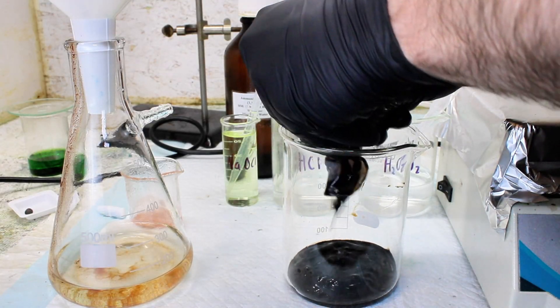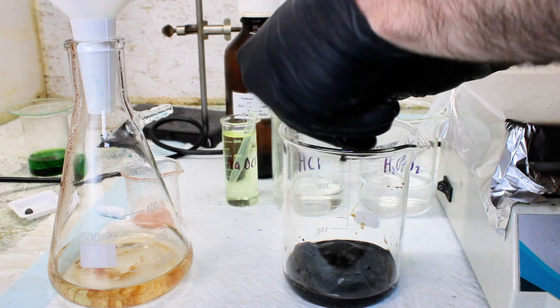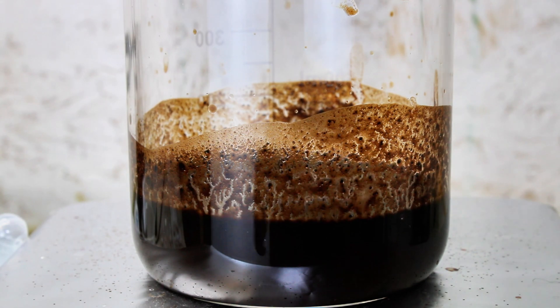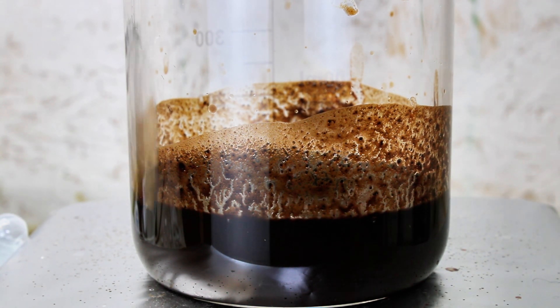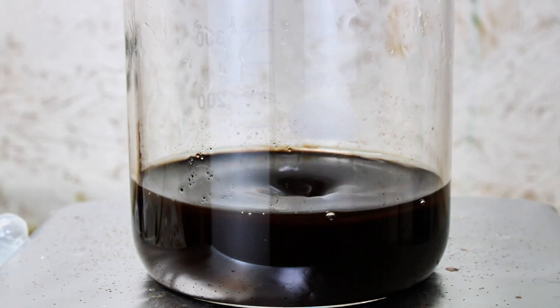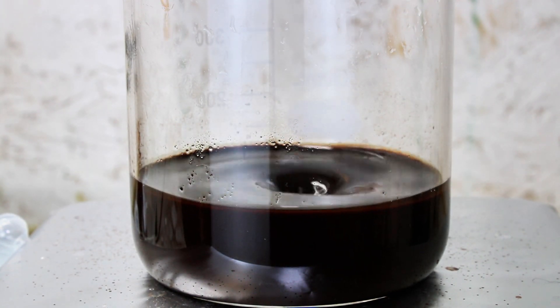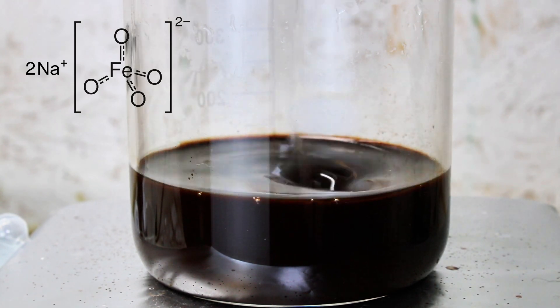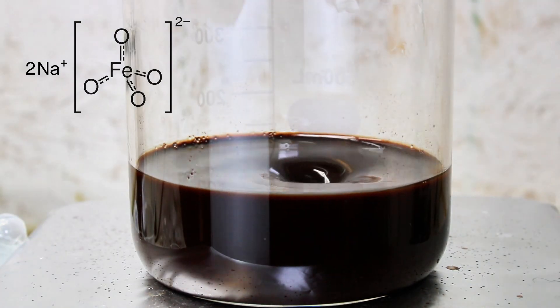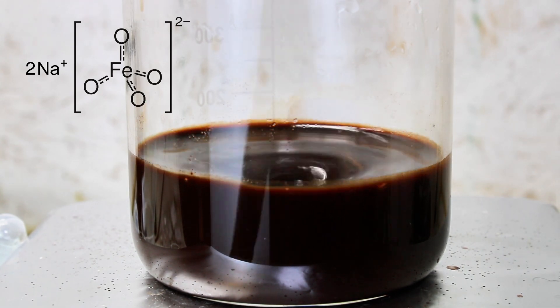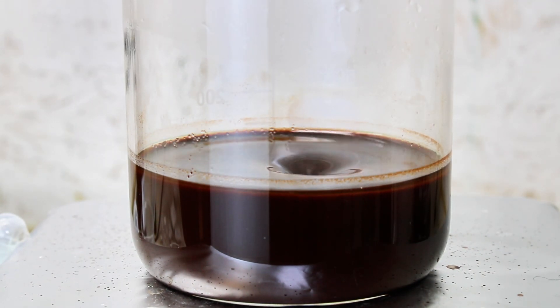And then I begin to slowly add a solution of 10% sodium hypochlorite under constant stirring and aggressive heating. This will oxidize the iron to its +4, +5, and finally its +6 hexavalent state. Inorganic iron compounds in the 4 and 5 states are highly unstable, but the hexavalent ferrate ion is decently stable in strongly alkaline solutions.